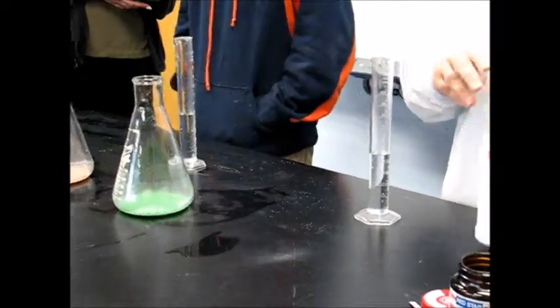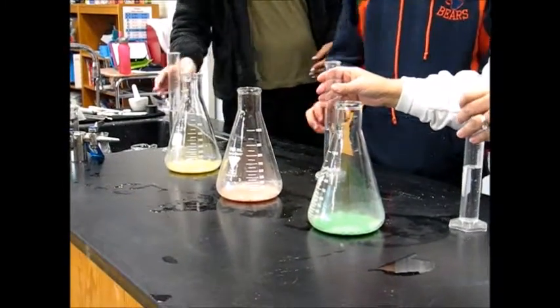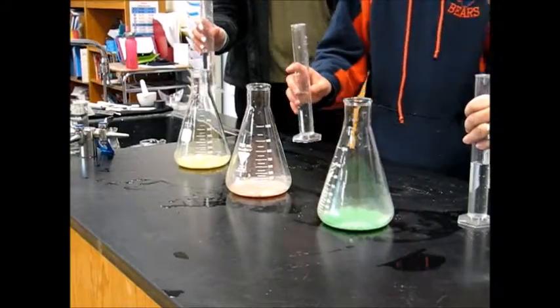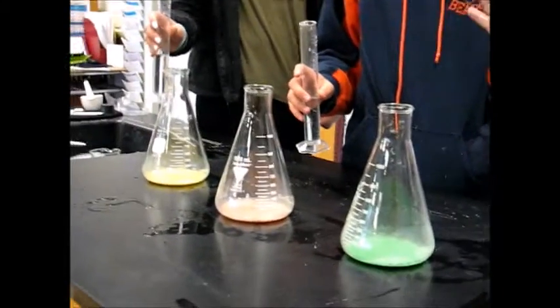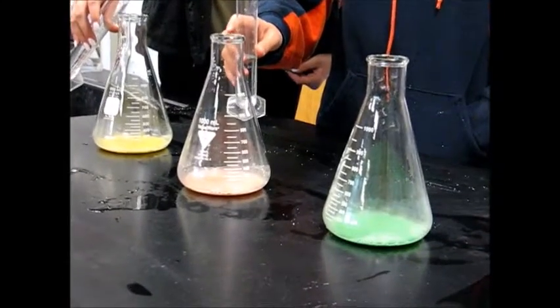So guys, we're gonna pour these in at the same time, okay? I'm gonna say 1, 2, 3, go. When I say go, that's when you're gonna pour, and you're gonna pour fast, okay? Everyone needs to watch, so we're only doing this once, okay?